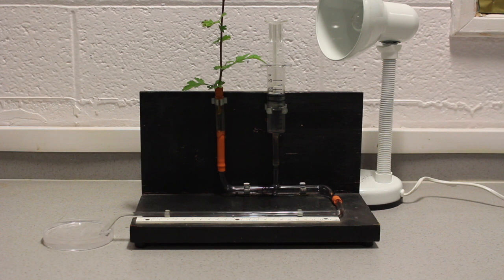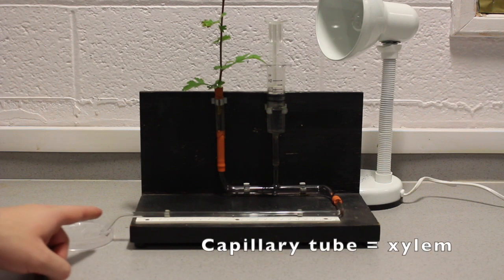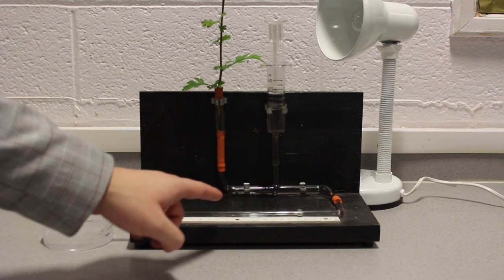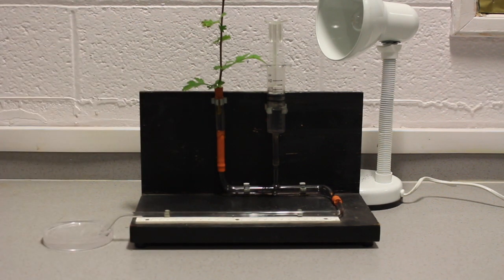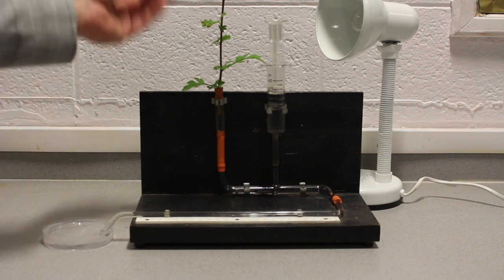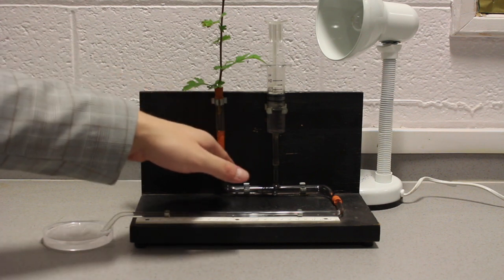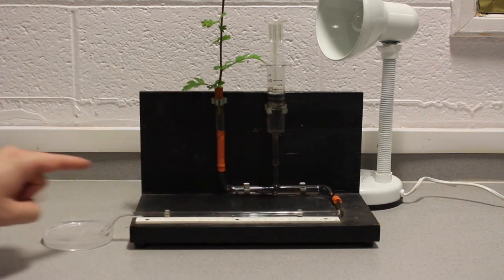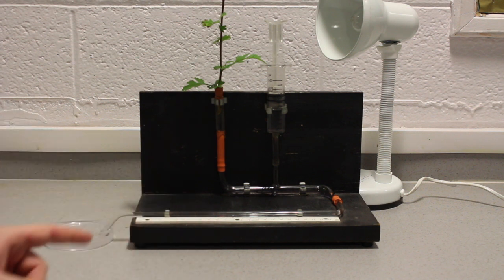In transpiration, water will move from the roots, which is simulated by this dish of water, through the xylem, which is simulated by the capillary tube, through to the leaves, where it will be lost via evaporation through the stomata. And as it's lost through the leaves, it will replace that lost water with water from the stem, which is then replaced with water from the roots. And what we can see in the capillary tube is a tiny air bubble which will move along the ruler, and we can measure both a start and end point and calculate a rate of transpiration.